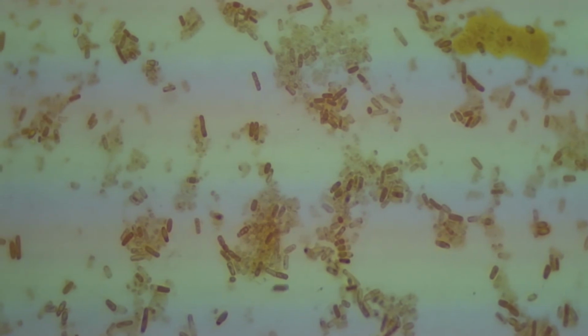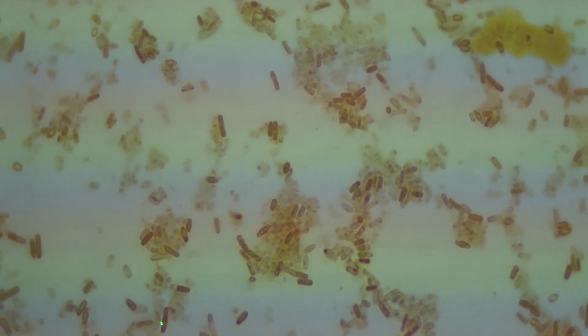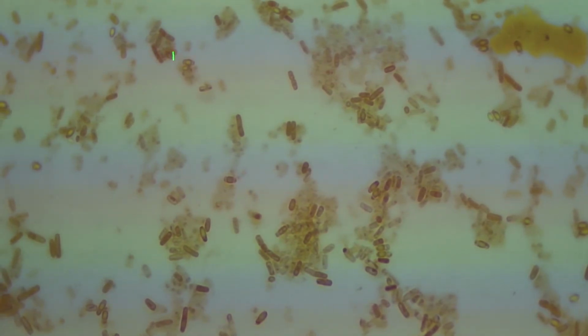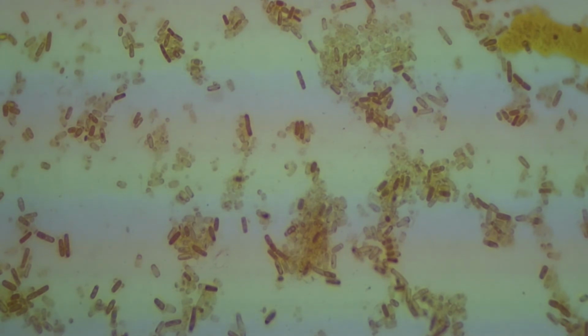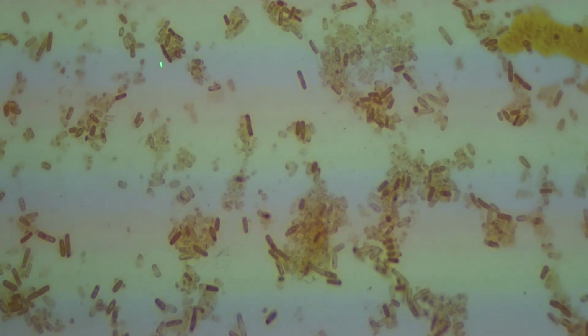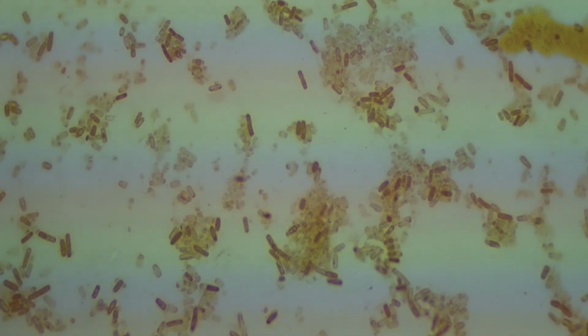And we have Bacillus subtilis. Although the rods are slightly pink here, we have a lot of hollow egg-shaped spores that you see on the screen that they don't appear to have taken up safranin very well. Let me get it, there we go. Get the color altered here just a little for you. So spores, which are egg-shaped, do not in fact take up dye well. So you end up getting a lot of what look like hollow eggs here. But you can still see some of the vegetative pink rods of Bacillus subtilis, a long, thick bacillus.